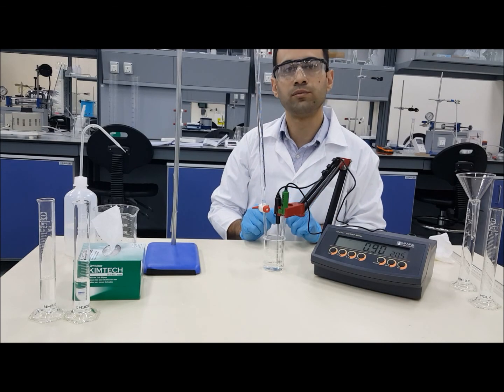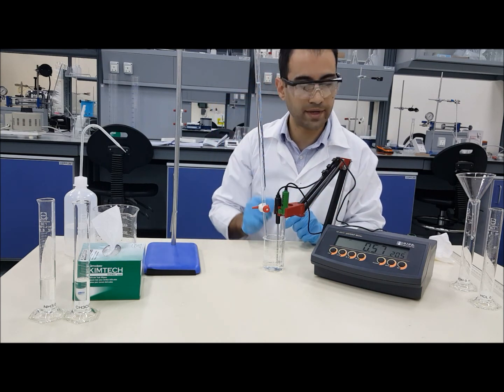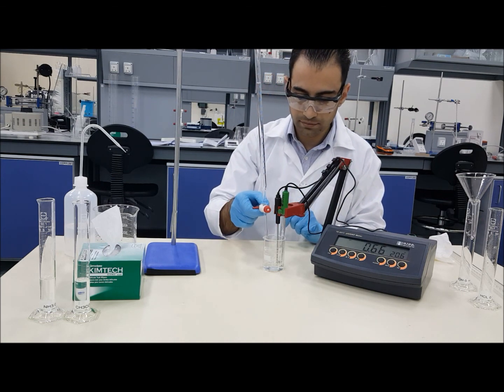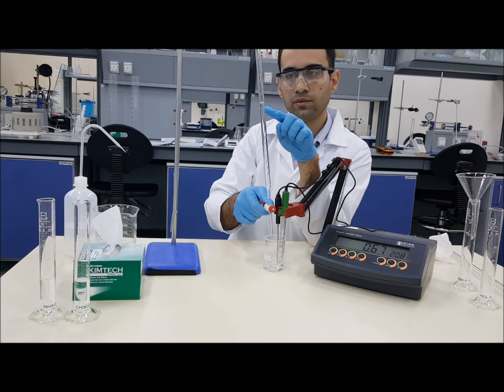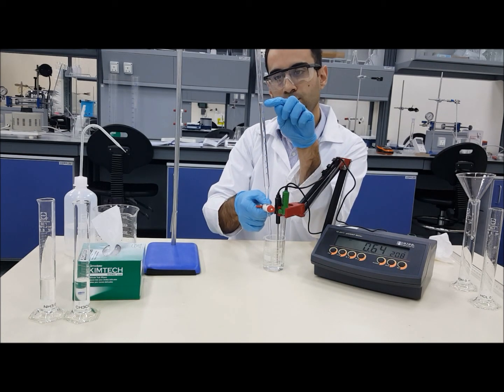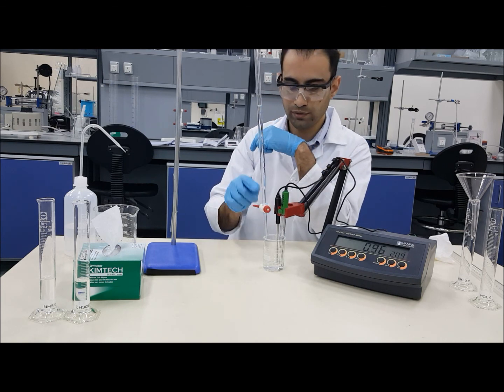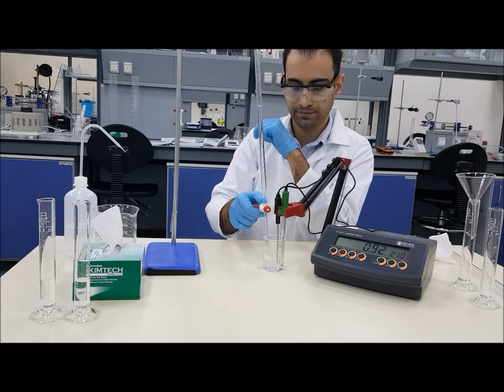You will need to keep doing so, taking in consideration the volume added and the pH changes. Always refer to the volume measurement while adding, and you can see the liquid level is changing slowly in here based on how much we are adding. You can always control this valve to slow or make it faster.